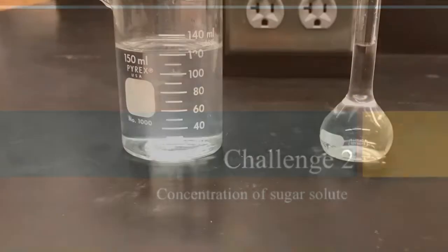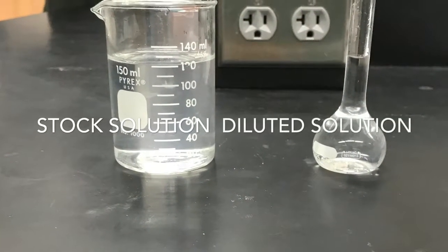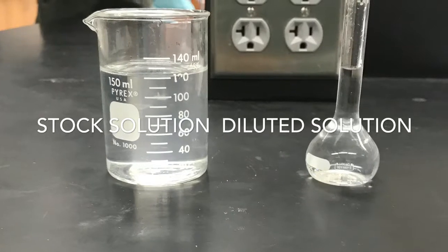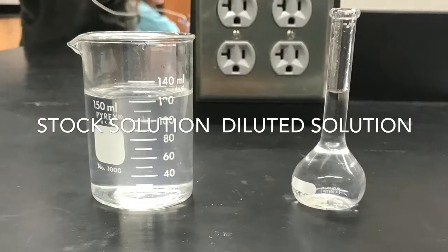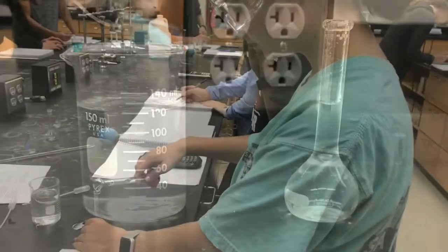Next, we will take a stock solution to prepare a dilution. A stock solution is prepared so that you can make solutions of lesser concentration from it. A dilution is created with lesser concentration from the stock solution.